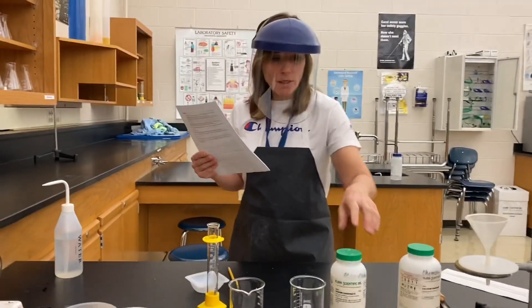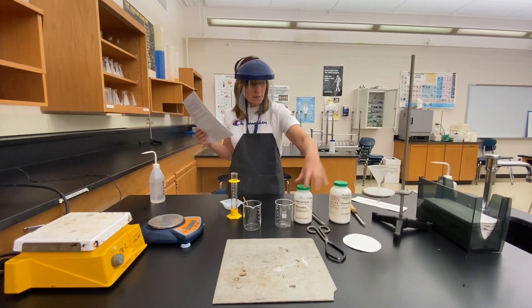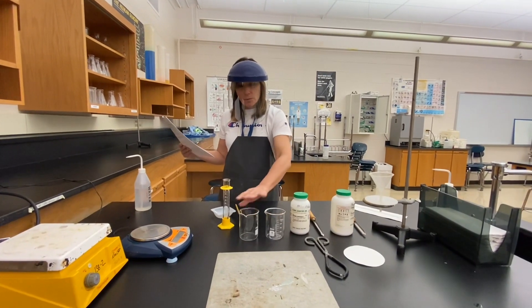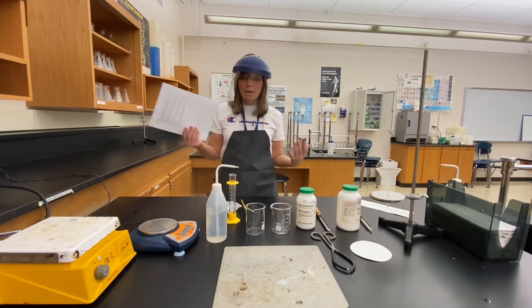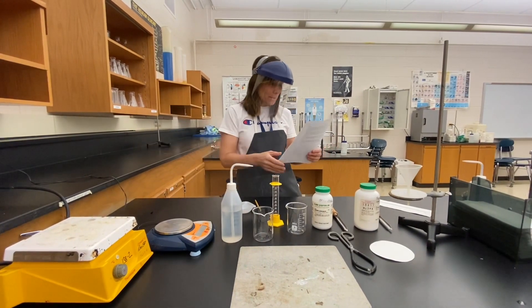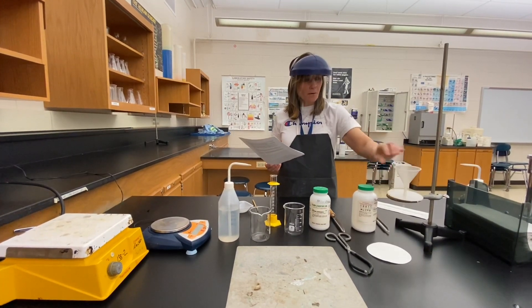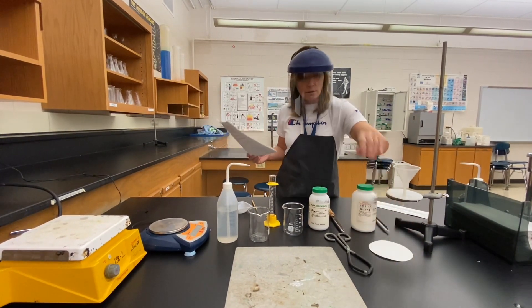Let's take a look at the materials. We're going to be doing a reaction between sodium carbonate and calcium chloride — both white powders or white solid materials that we'll dissolve in water. We have two beakers, distilled water which is pure H2O with nothing dissolved in it, a graduated cylinder, massing boats, a balance, a hot plate, a ring stand with a ring, a funnel, and filter paper to filter our solution and retrieve our solid.